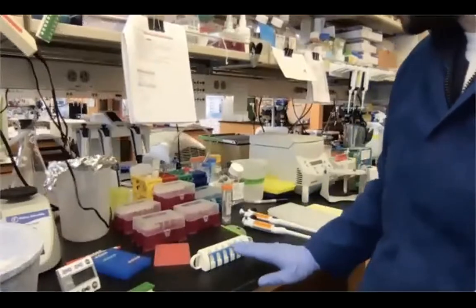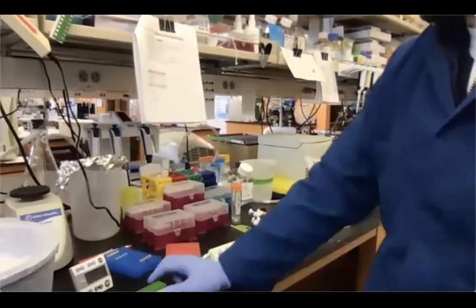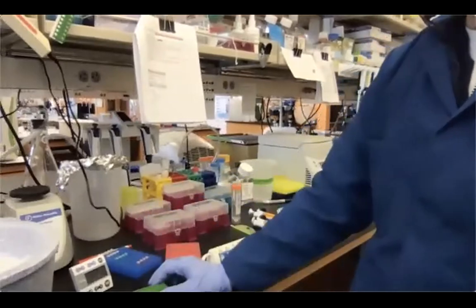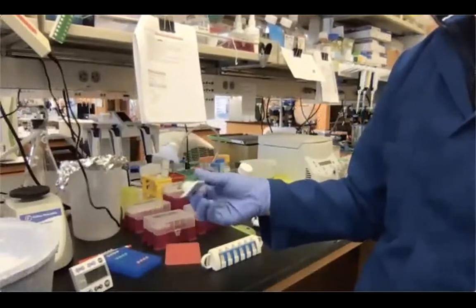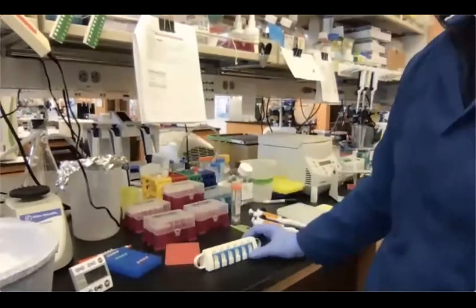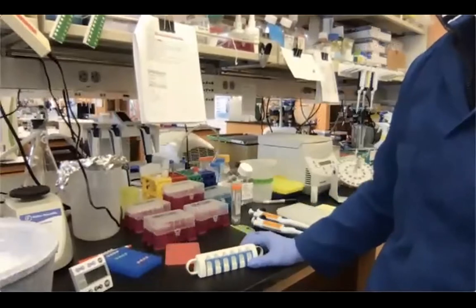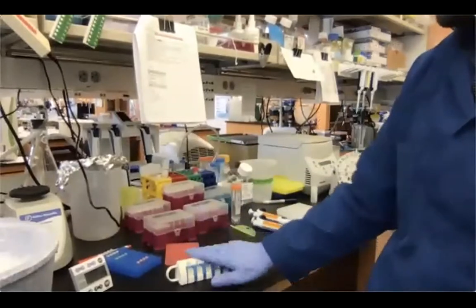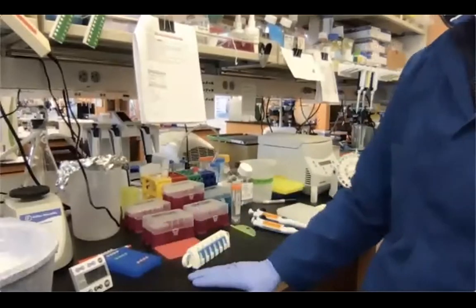In the meantime, I'm going to briefly talk about the tubes that we are going to perform our purification in. As of now, we have our samples in PCR tubes. You can perform the purification in PCR tubes. Just use one of these or a similar magnet that fits PCR tubes. However, today, to let you see a little bit better, even if I know that the quality of the recording is not going to be great, I'm going to use 1.5 ml tubes. So what I'm going to do is I'm going to transfer our library that has been adapter ligated into 1.5 ml tubes.